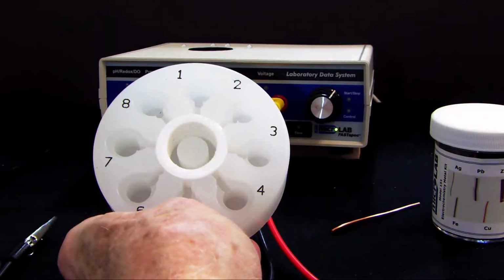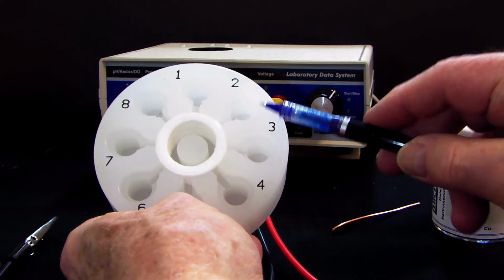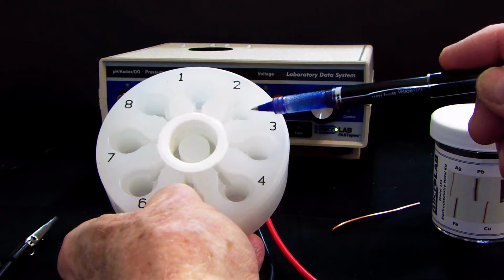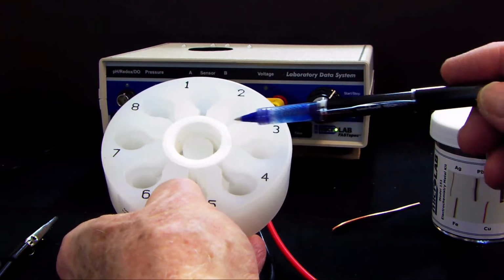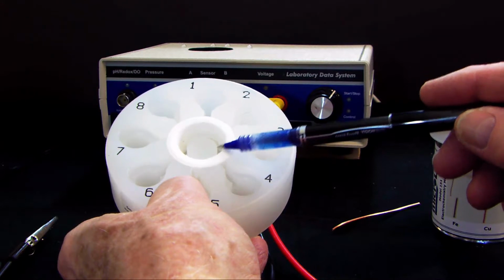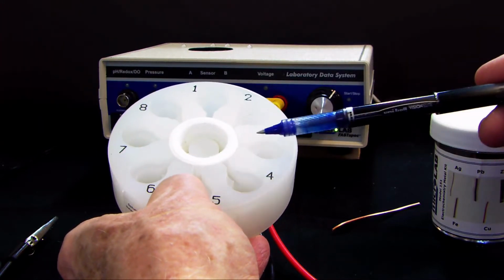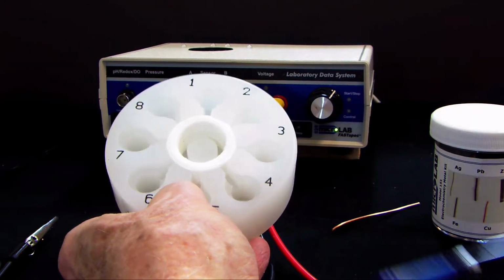I have here an electrochemical half-cell module. This has 8 little cylinders in it, and these will hold about 3 milliliters of an ion solution. They connect through a little channel here to a porous plastic sleeve, and we put potassium nitrate in the middle for a salt bridge. So these can be coupled by motion of ions through that liquid, but the ions won't move very fast because of this porous cup.